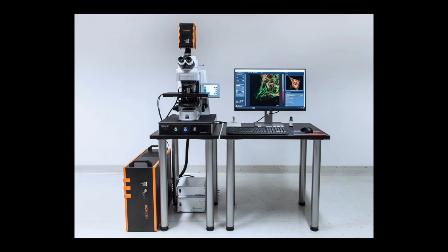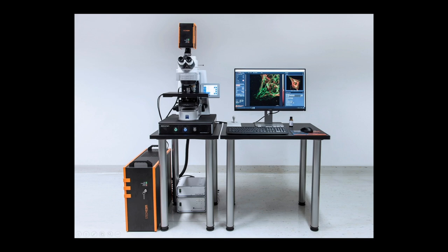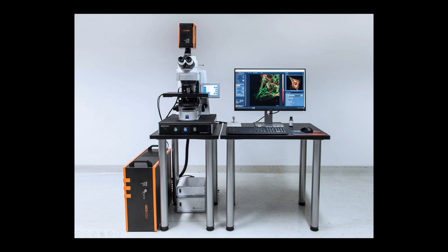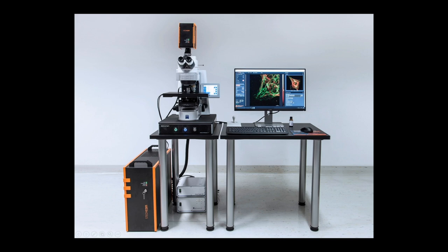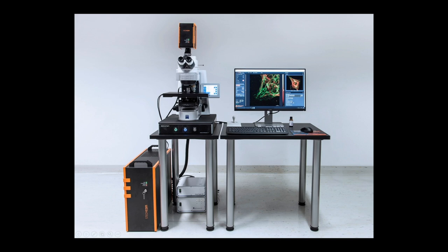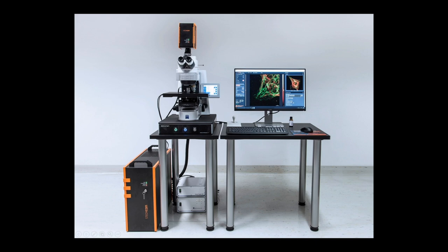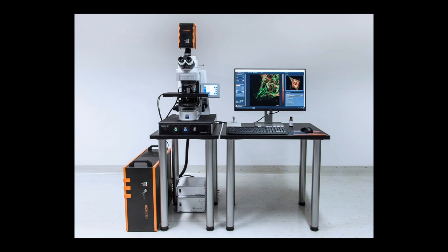So that was the STED part. Now we put everything I just explained into one box, which is the STEDYCON. It's quite a small box — it just stands next to the microscope. The lasers and detectors are inside, and on top we have the scanner, the phase plate which converts the STED laser to a donut, and also our pinhole. You can attach the STEDYCON to basically any microscope body that has a free camera port — for example to an upright or inverted microscope using the camera side port. So if you have an old microscope body standing around, you can directly attach the STEDYCON, and it works really nicely as both a confocal and a STED microscope.